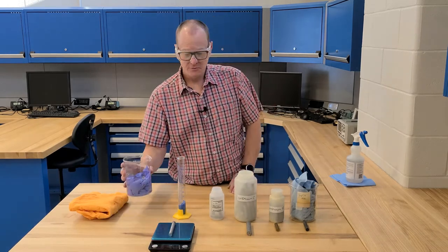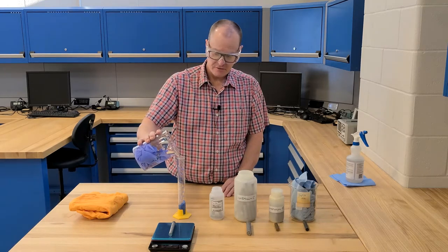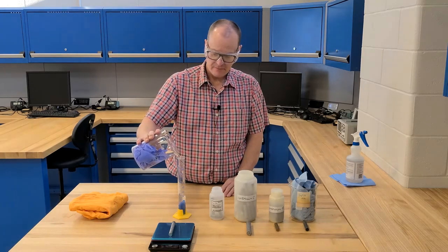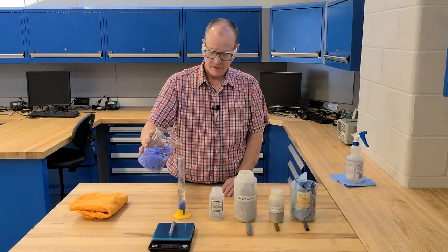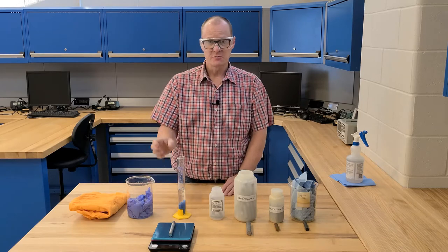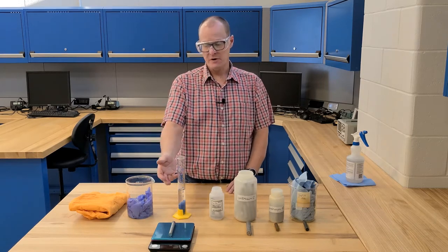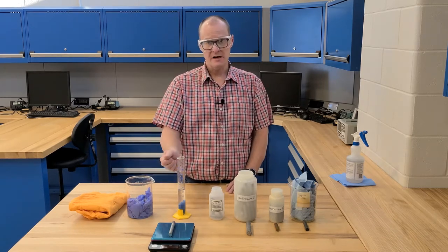Then take your beaker and fill up your graduated cylinder about halfway. We'll start at halfway because when you put your samples in, it's going to displace more water and we don't want to go past the top.